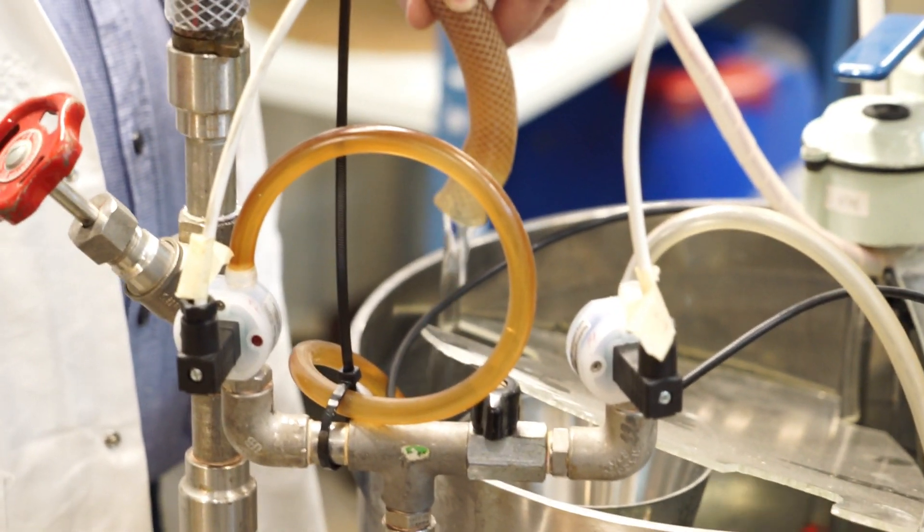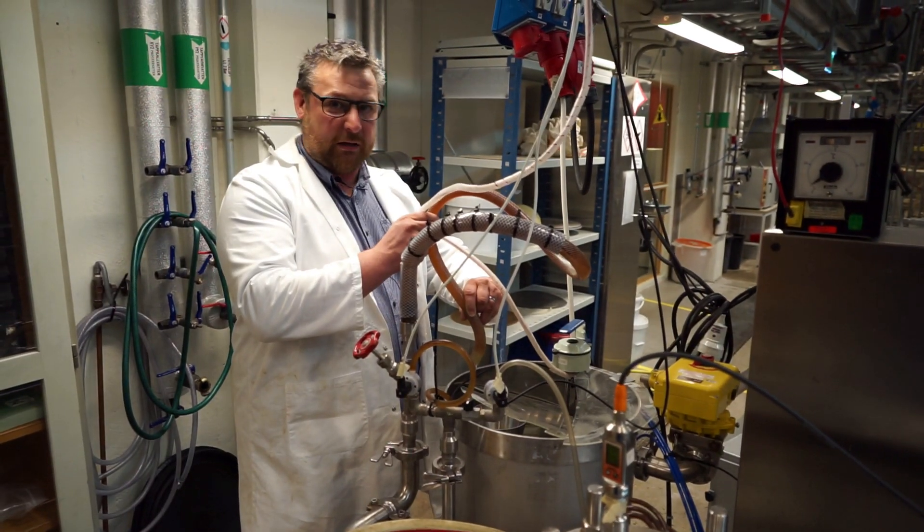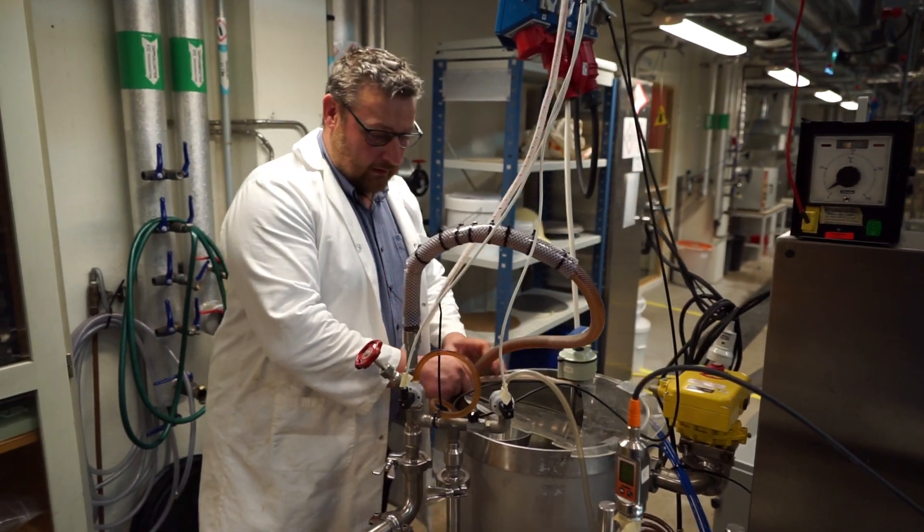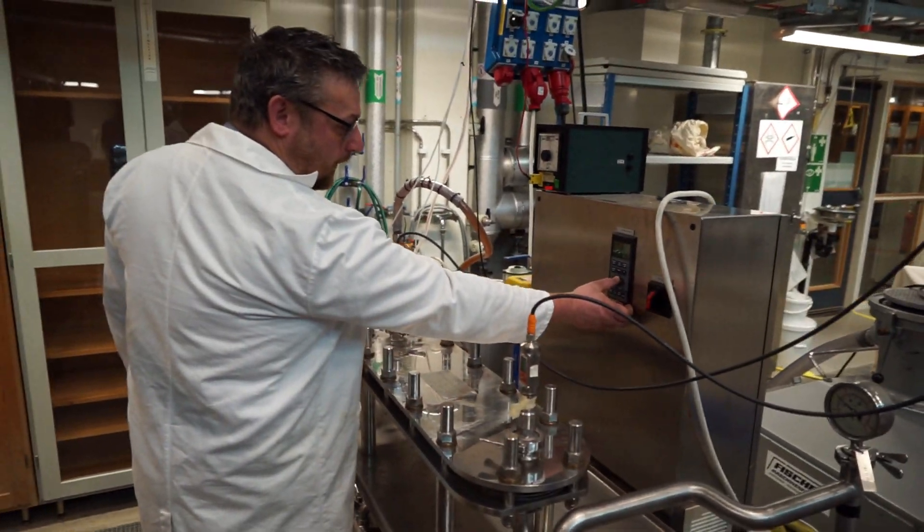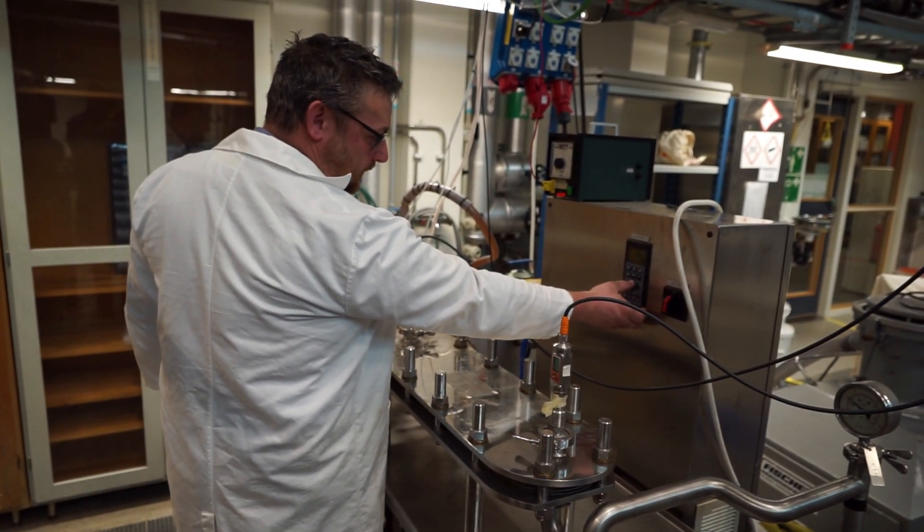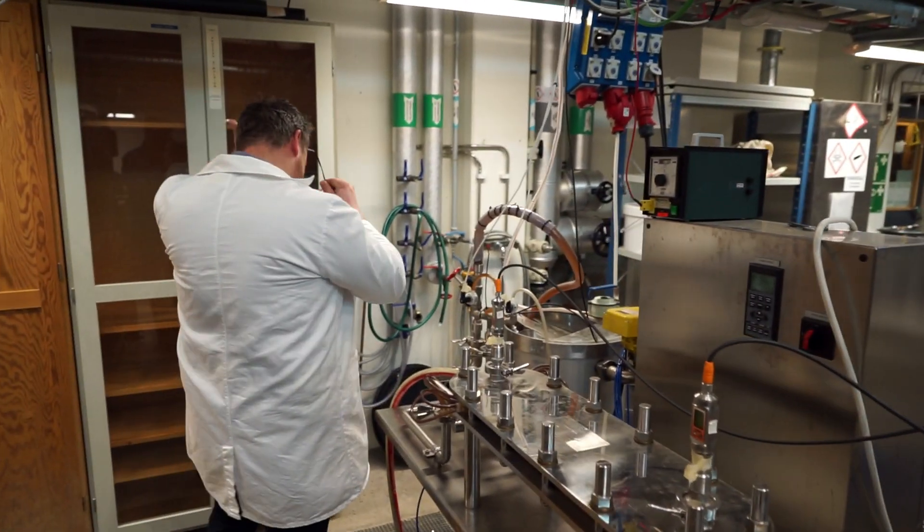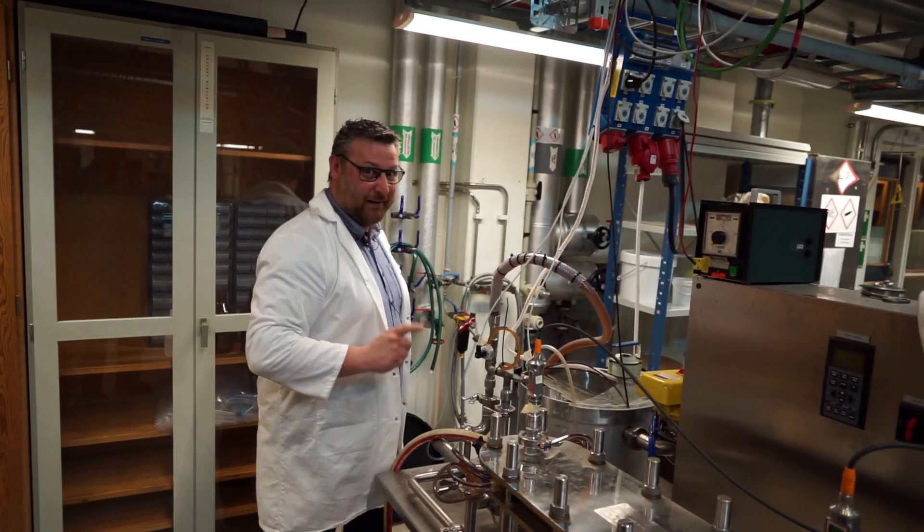Because this is a centrifugal pump, so this pump is affected by the pressure it needs to overcome. So, in order to keep the flow up, I now have to increase the set point of the pump. To keep the retentate flow steady.